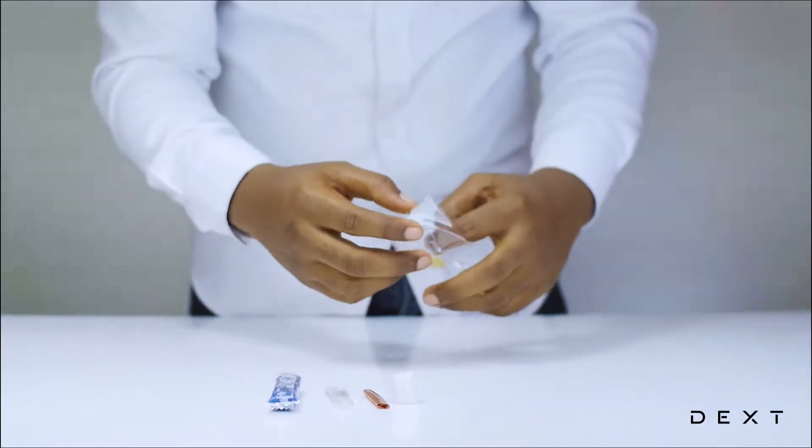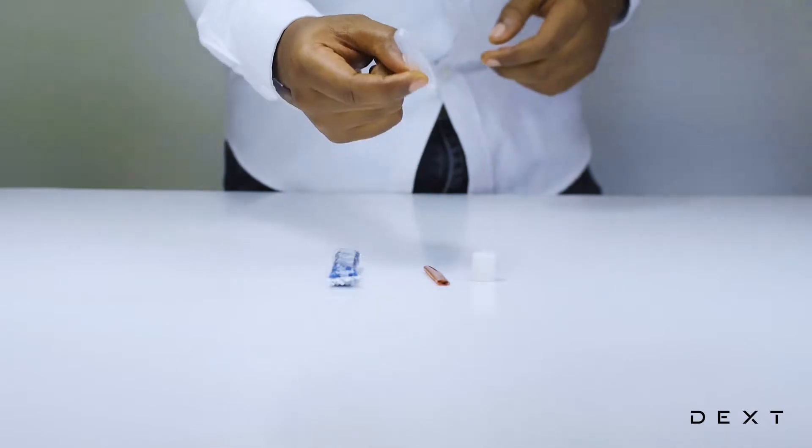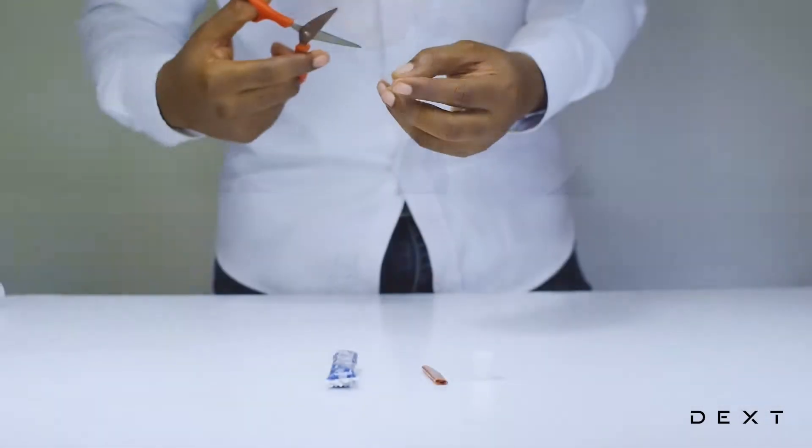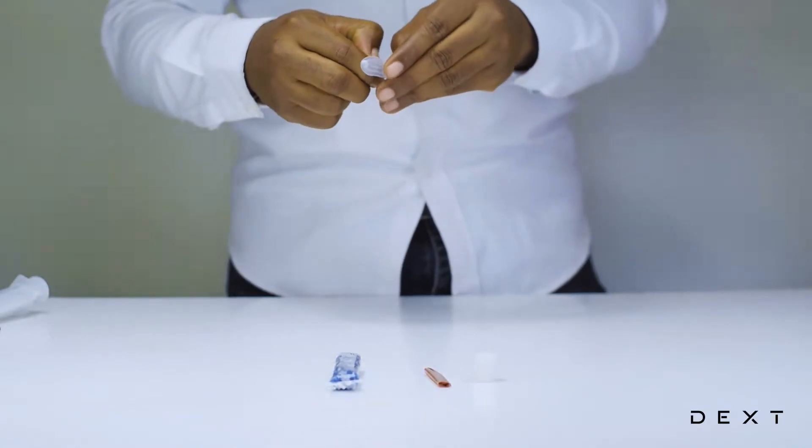Using these materials, we are going to demonstrate that oxygen supports burning. So the first thing we are going to do is to take our tube. Let's gently take the tape off it so that it is nice and straight.